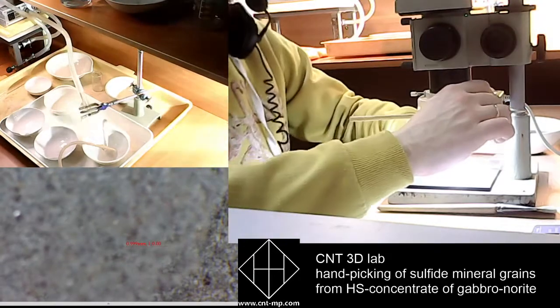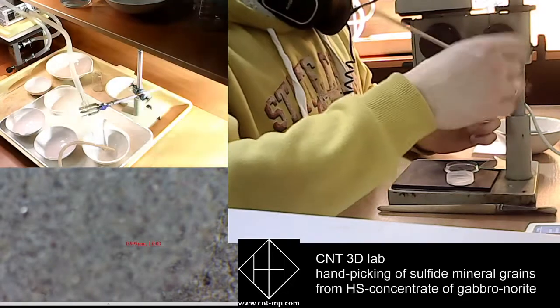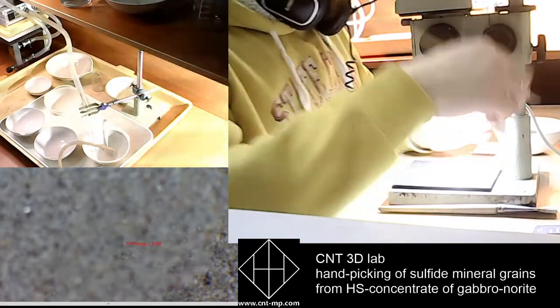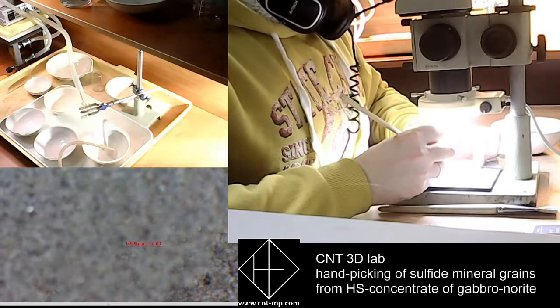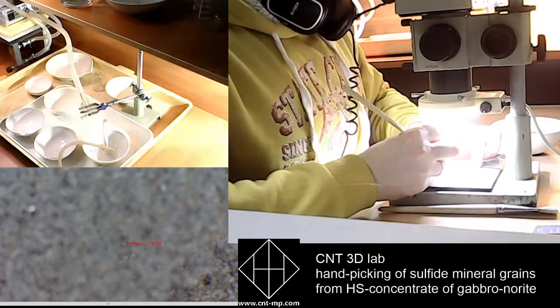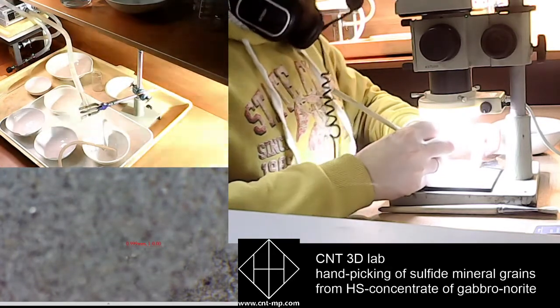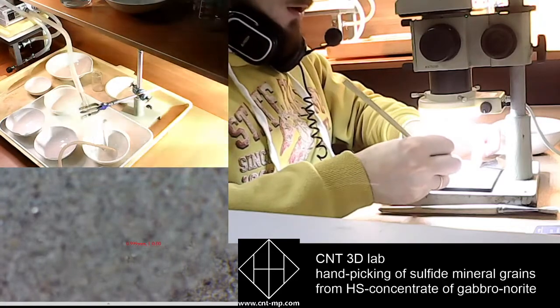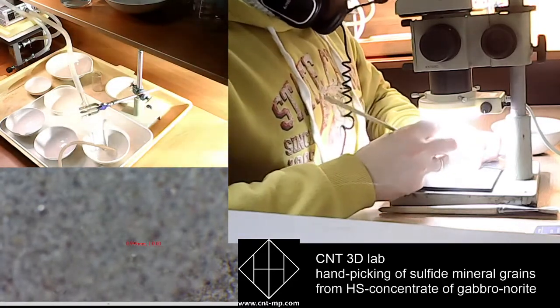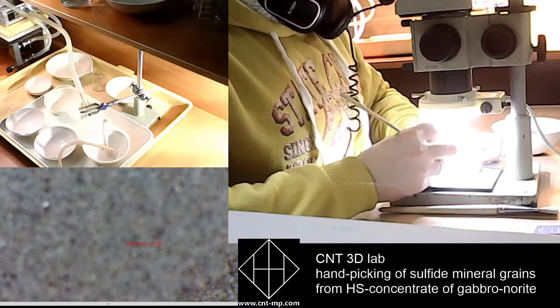Patience, patience. Of course, this work is not so simple, as you have to be very accurate in collecting the grains and moving them between your containers. The main goal is to not lose anything.